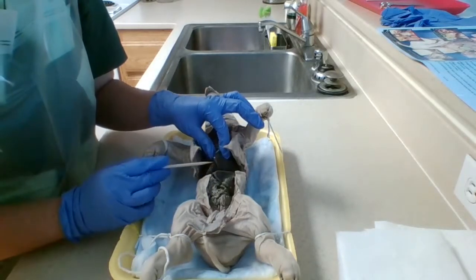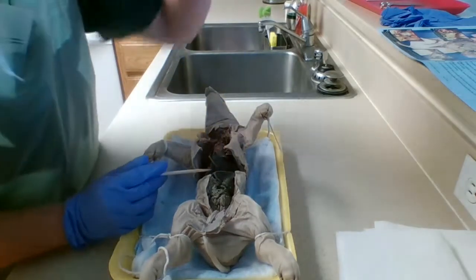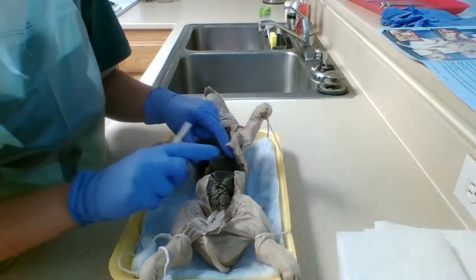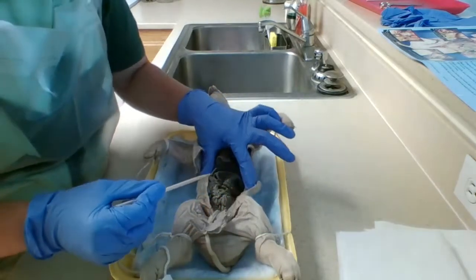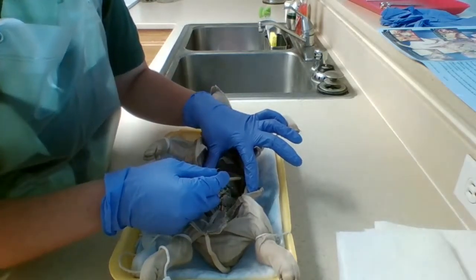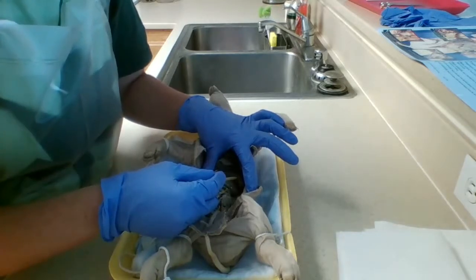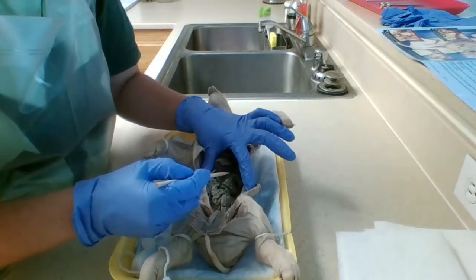Just below the liver and the umbilical vein is the stomach, and it's the chamber that holds and digests food. And next to that we have the spleen. Let's see if you can see it. Open that up a little bit. Right here we have the spleen, and the spleen filters and stores blood. It filters out and gets rid of old, worn out red blood cells, and it's your natural immune system that fights against germs.